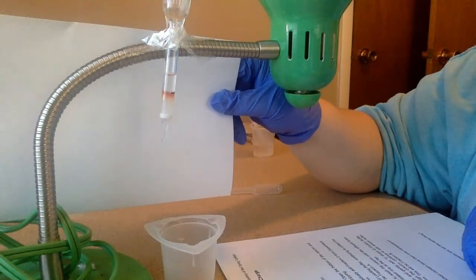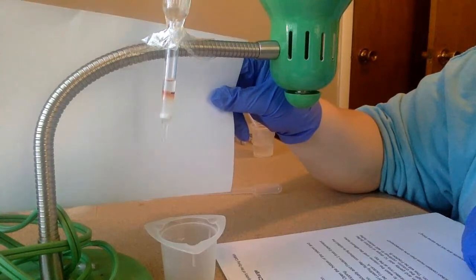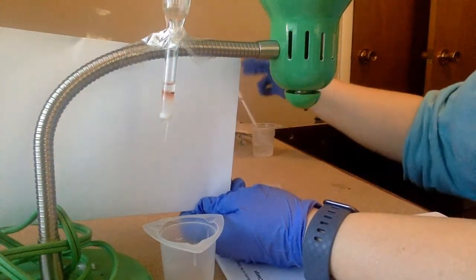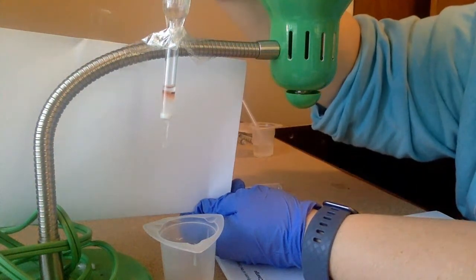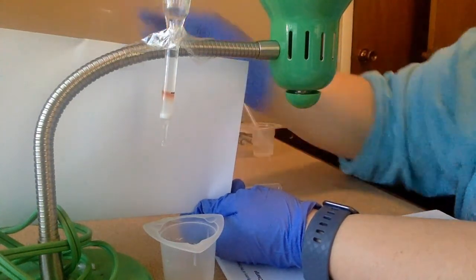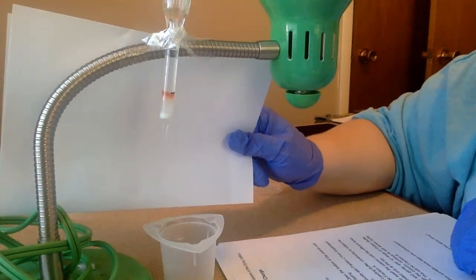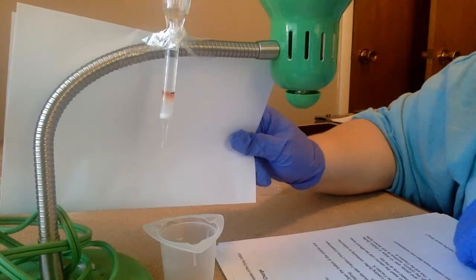Okay. Step 4 says go ahead and continue to wash until what comes out looks colorless and is only concentrated at the top. And I'll put one more pipette full through here, but it's already starting to look fairly colorless. But just to be sure, I'm going to continue to rinse it a little bit longer. One thing about these ion columns is they go fairly quickly, so I'm just going to let this rinse through and we'll move on to step 5.